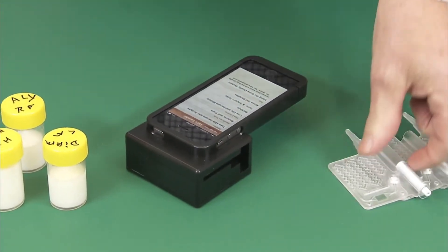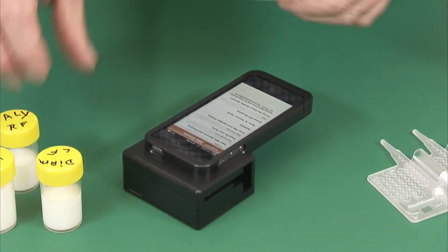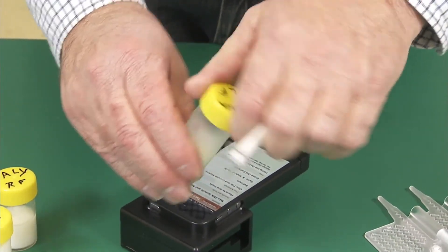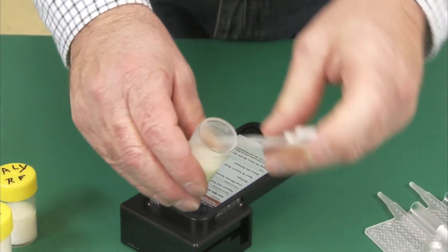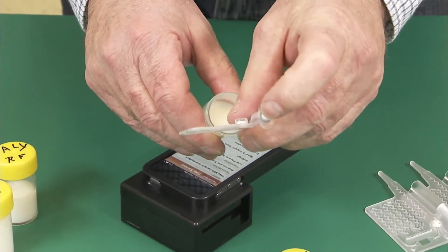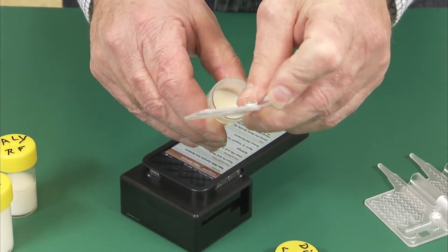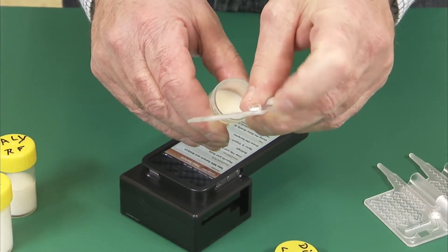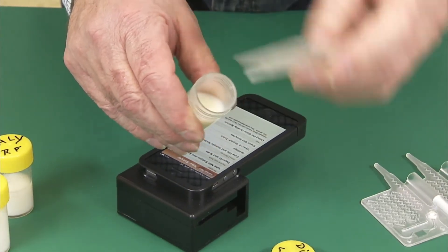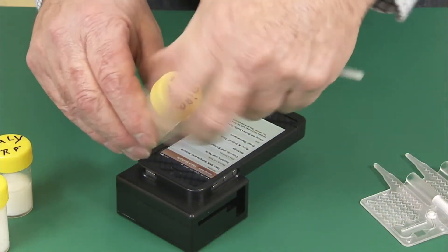We will then use a cassette with our first sample of milk. We dip the cassette into the milk and firmly press on the white piston — the milk is drawn into the cassette.